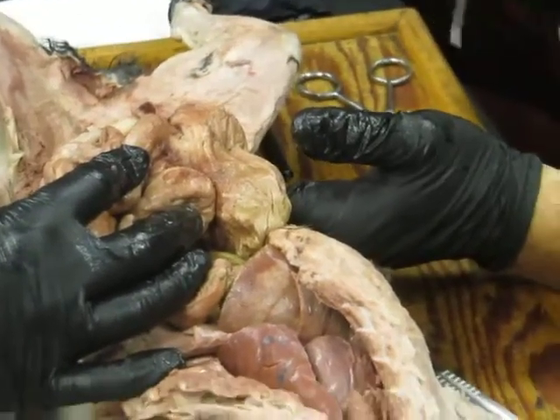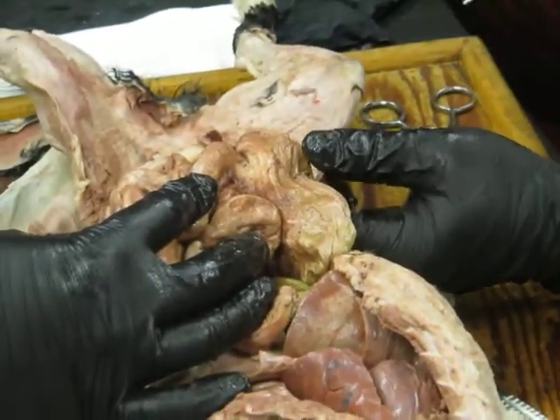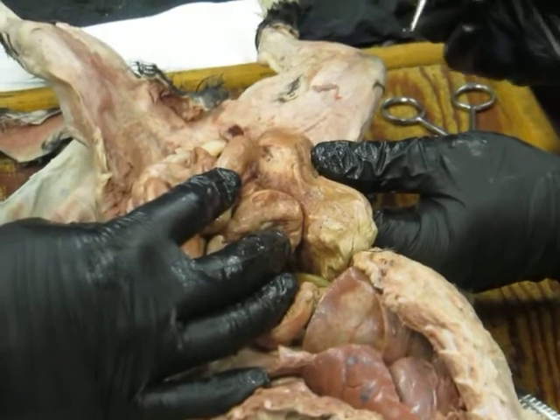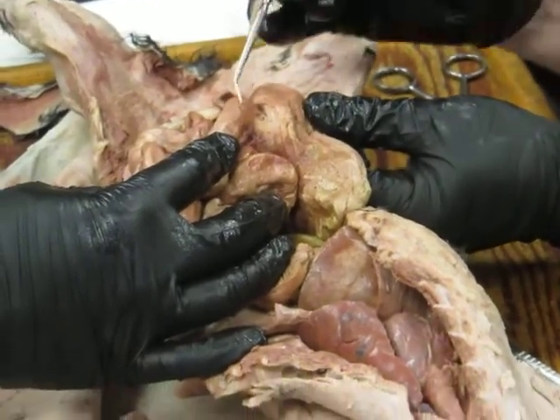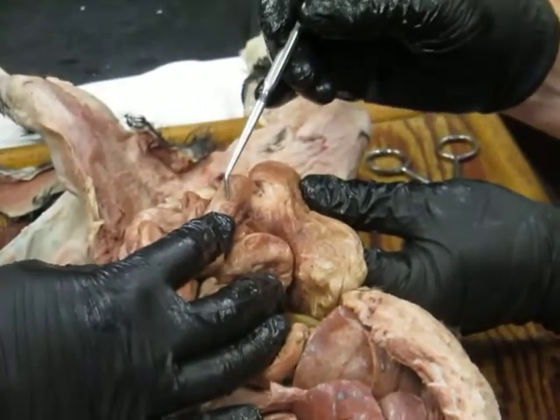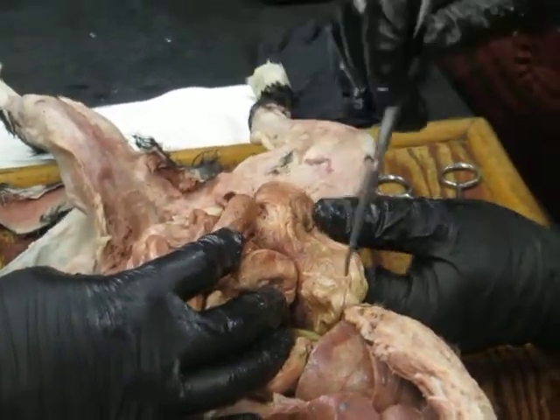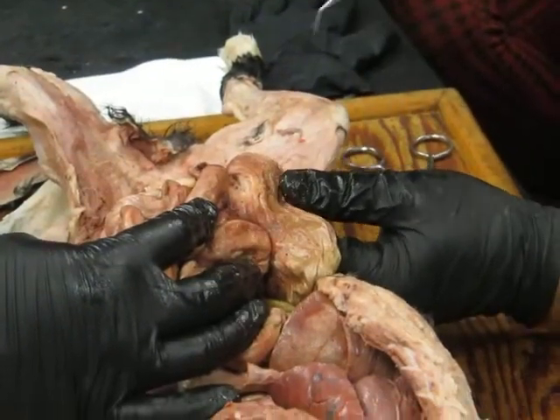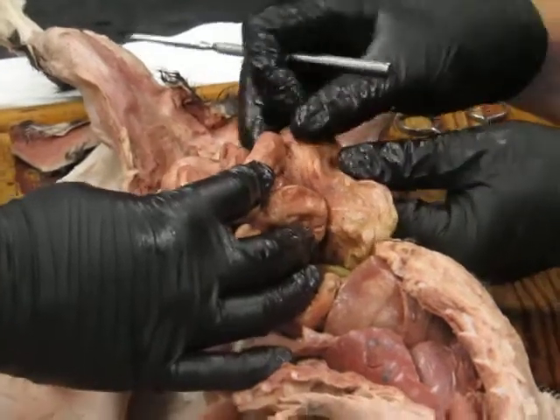And there's no way to tell those three things apart really clearly at the gross anatomical level. Histologically, if you cut microscopic slides and look at them, you can tell those different regions because they have different glands associated with them, but we can't tell the difference. So if I ever wanted to ask you about ileum, I would stick a pin in the last little bit of small intestine right by the large intestine, and you would know that's got to be ileum. Likewise, duodenum, I would never ask you jejunum because who knows? It's somewhere in the middle of that. Okay. Punch me in the jejunum.